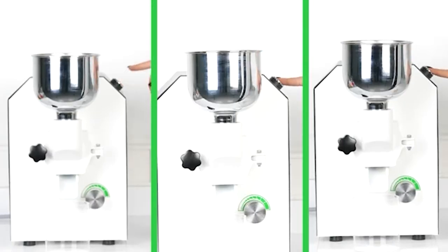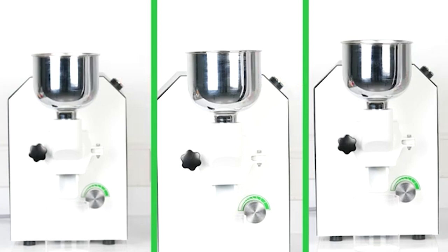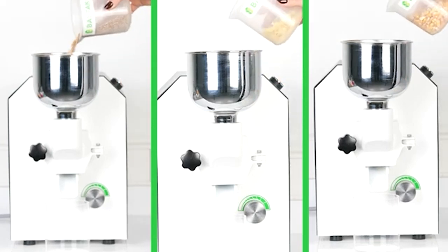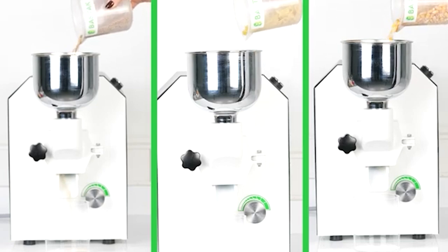Press the start button of the device. After the sample is prepared for grinding, load it from the sample feeding area to the device.